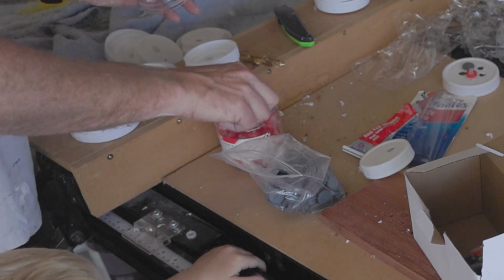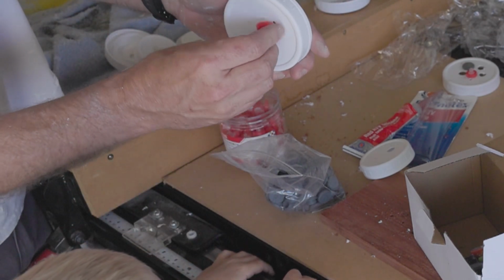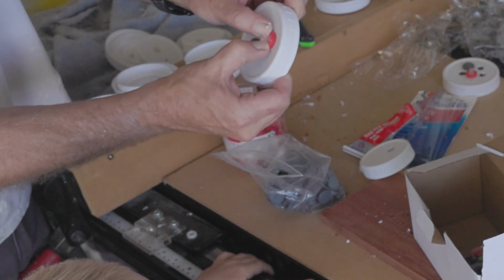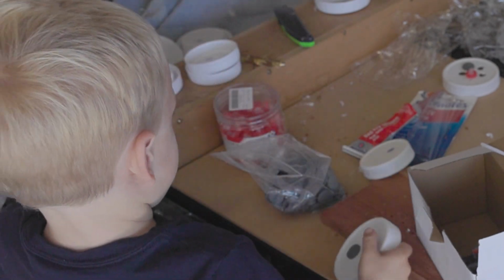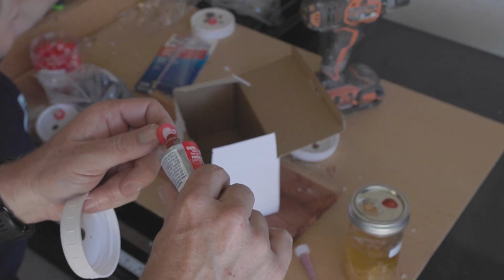How about these? You want to try these? These are easier. All you got to do is get it into the hole, and then you push it really hard until it's flat. That's all you gotta do. I think this is unnecessary.